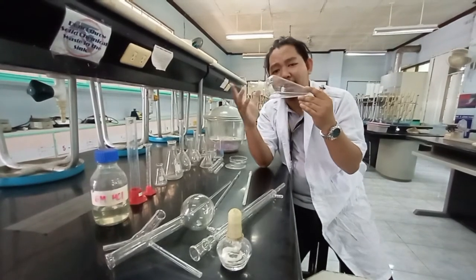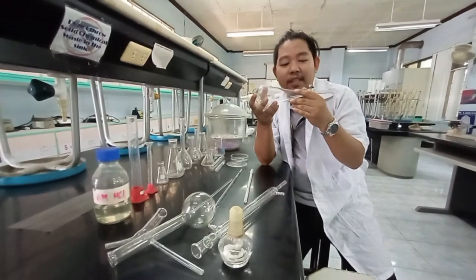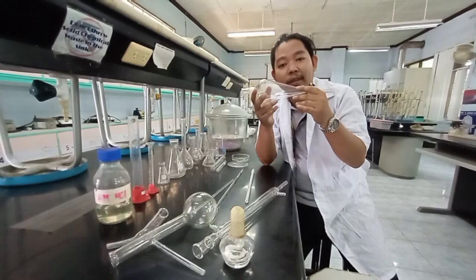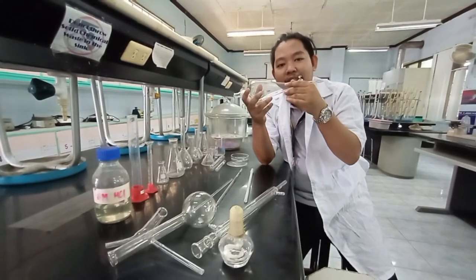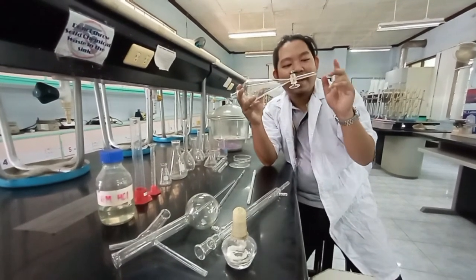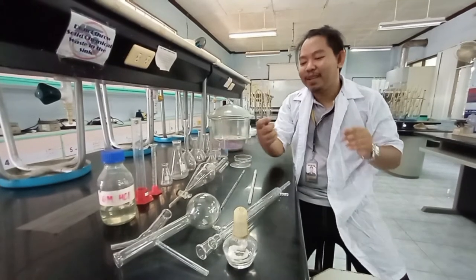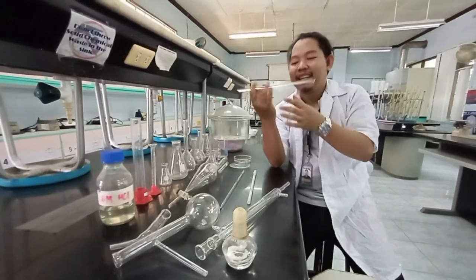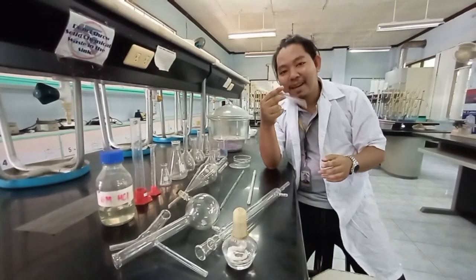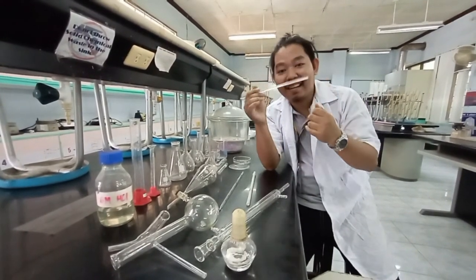For sure you're all familiar with this one because you've sketched it already — it's a separatory funnel. It is used to separate liquids. And we have here what we call the stirring rod — also called the magic wand. Kidding aside, this is a stirring rod.